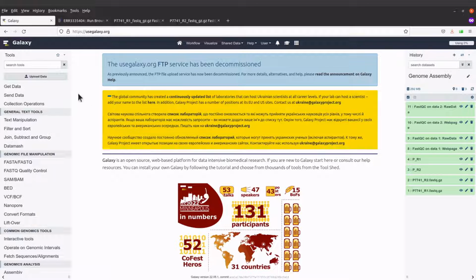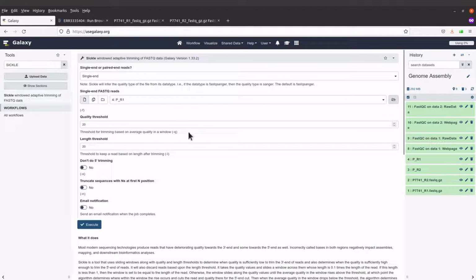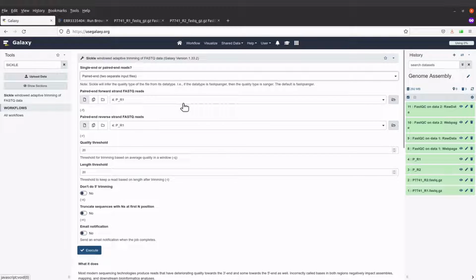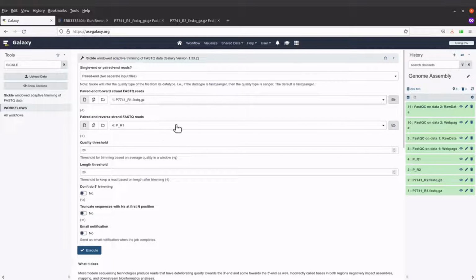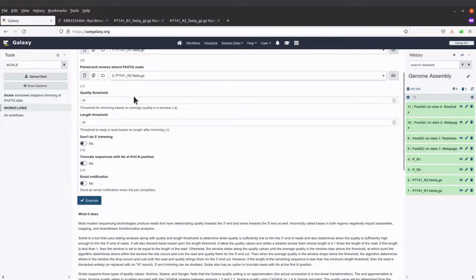So for the trim, we are going to use Sickle. So I will search for Sickle here. And then it comes up. So I'll just select it. And then when I come to this side, where we have single end or paired end reads, I'll select paired end, two separate input files. And then when I come here, it's asking for paired end forward strand FASTQ reads. So I'll select P7741_R1. And then when you come to the reverse strand, P7741_R2.